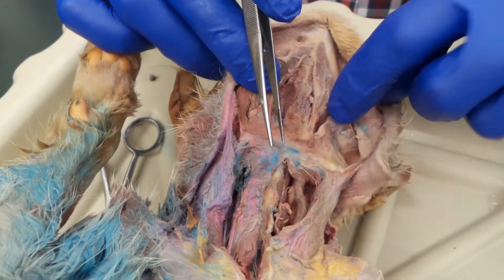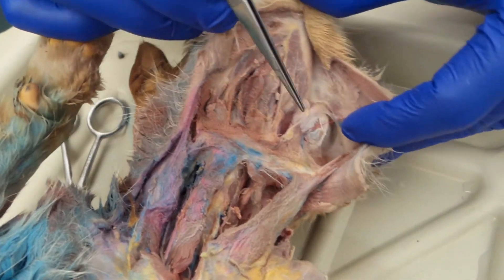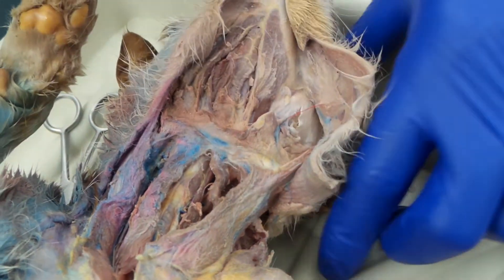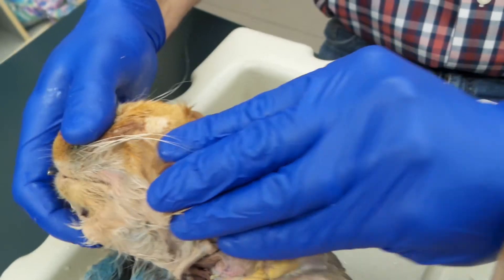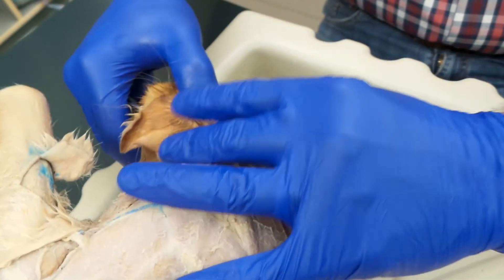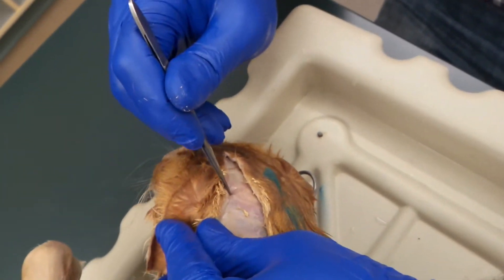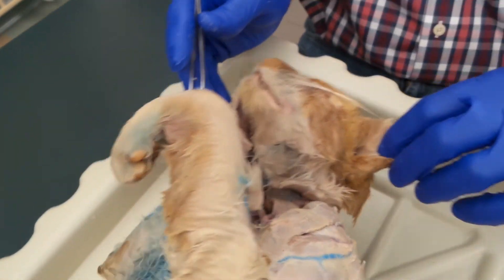Along the lateral side, on the cheek, is the masseter. And then right on the top of the head — flip this cat over — you have temporalis. That's it for day three.